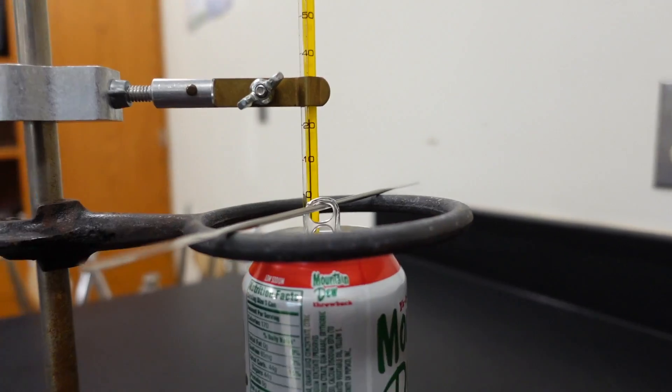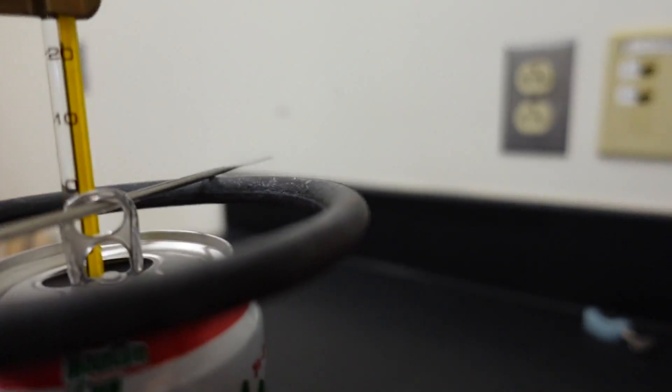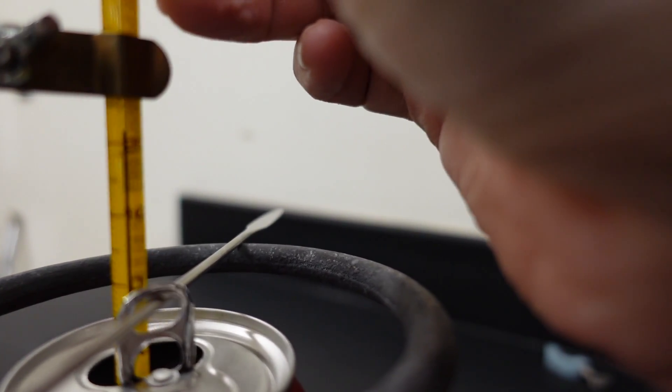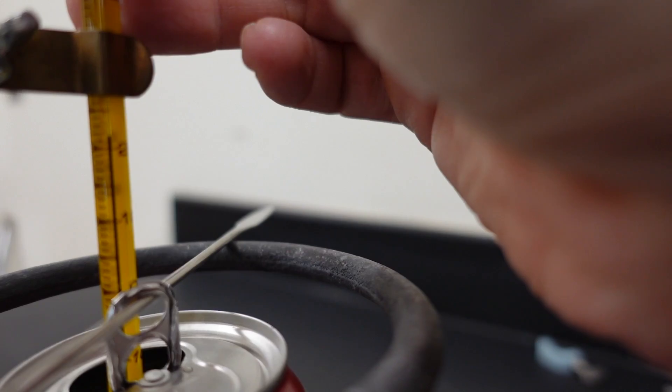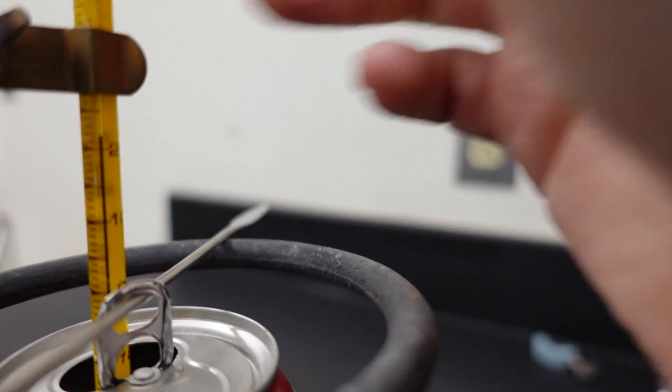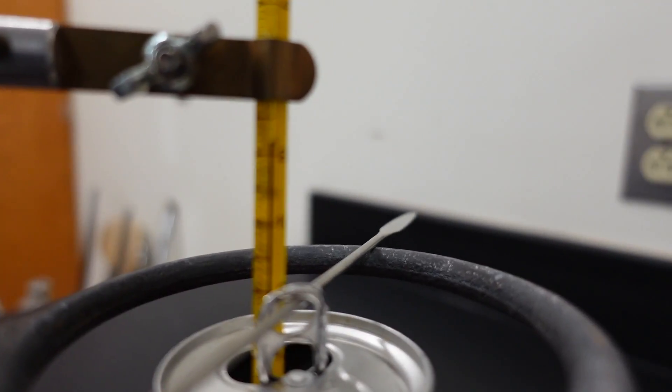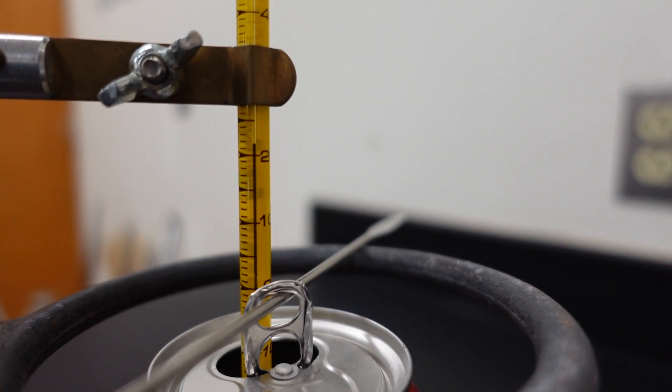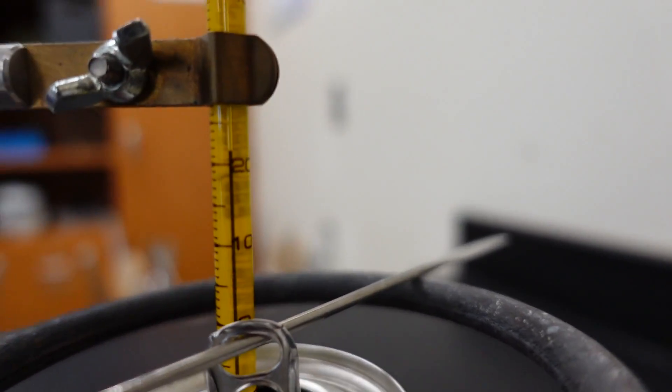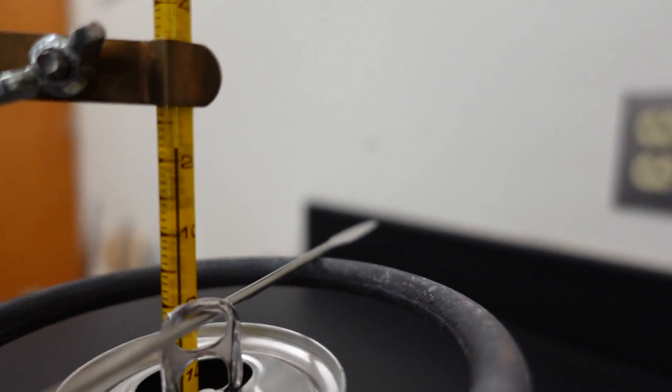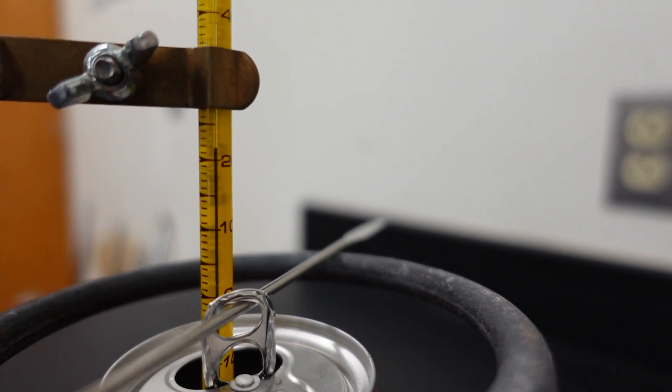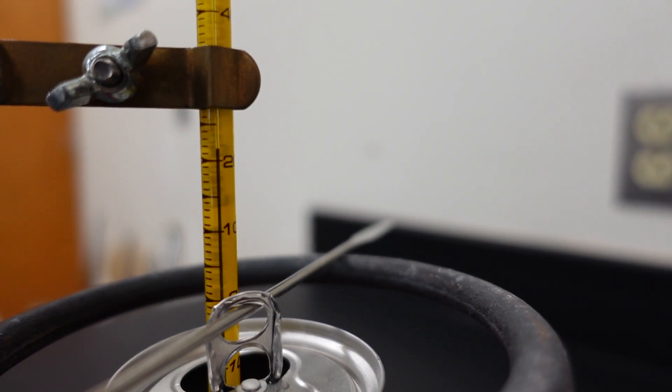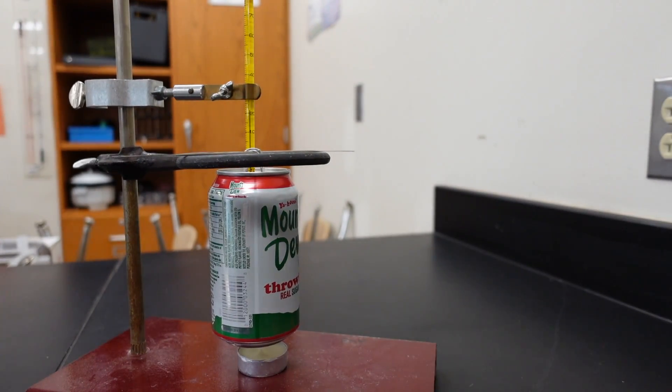And now, before I light the candle on fire and let it go for 10 minutes, go ahead and record the starting temperature. Let's get this so you can see it. Record the starting temperature of this water. That's 20 there, by the way. As you zoom around here, see, it's 20. So go ahead and record that starting temperature of the water.